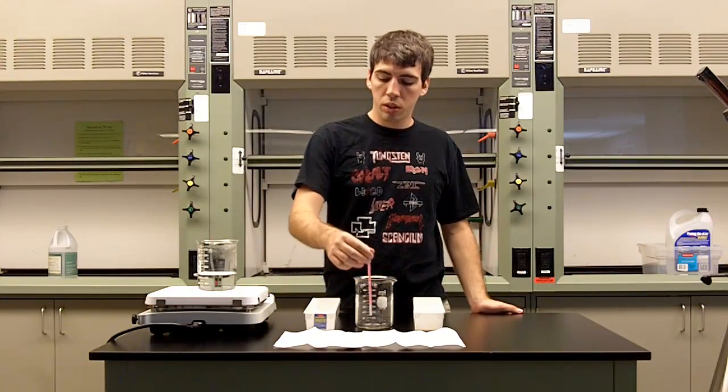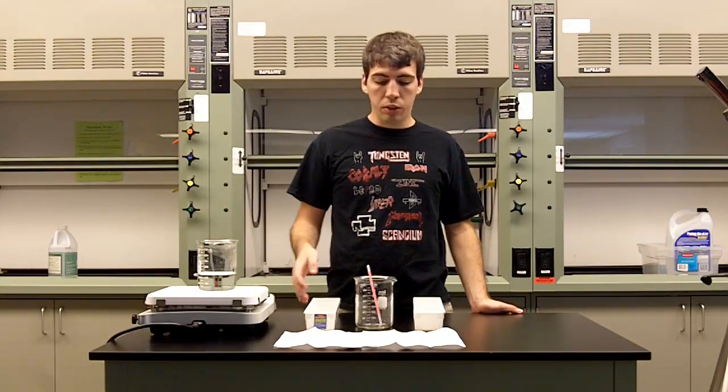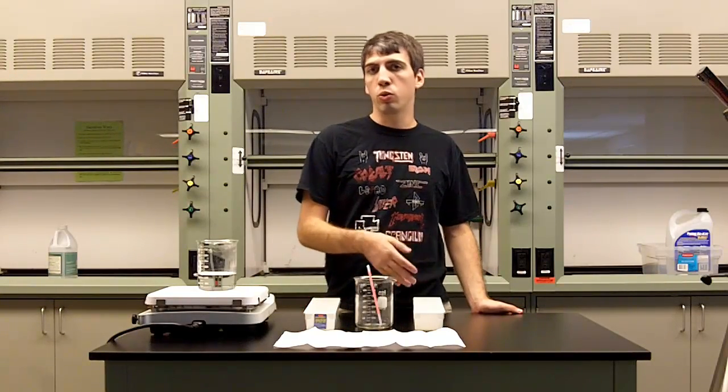Here we have one at room temperature, and over here we have one that's at 80 degrees Celsius and the other one that's in a cool water bath.